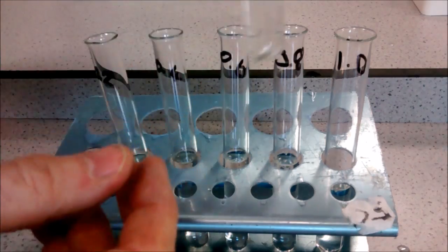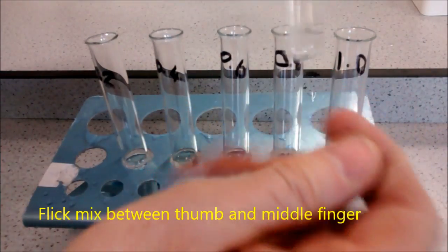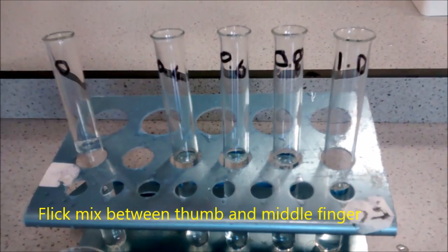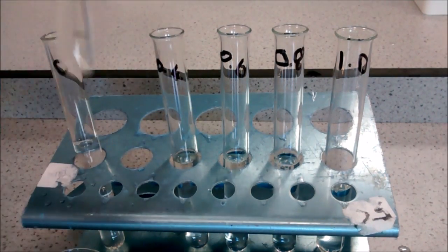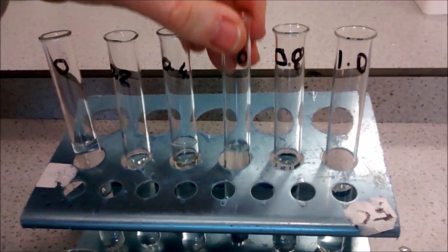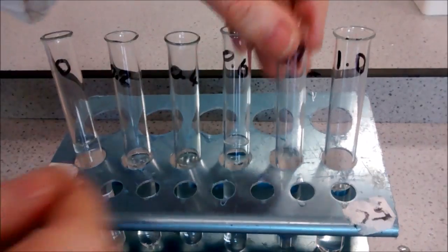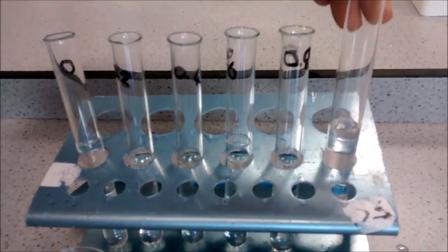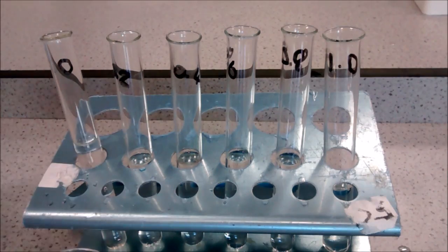These should all be briefly mixed. To mix, hold with your thumb and forefinger and give a flick mix like this.